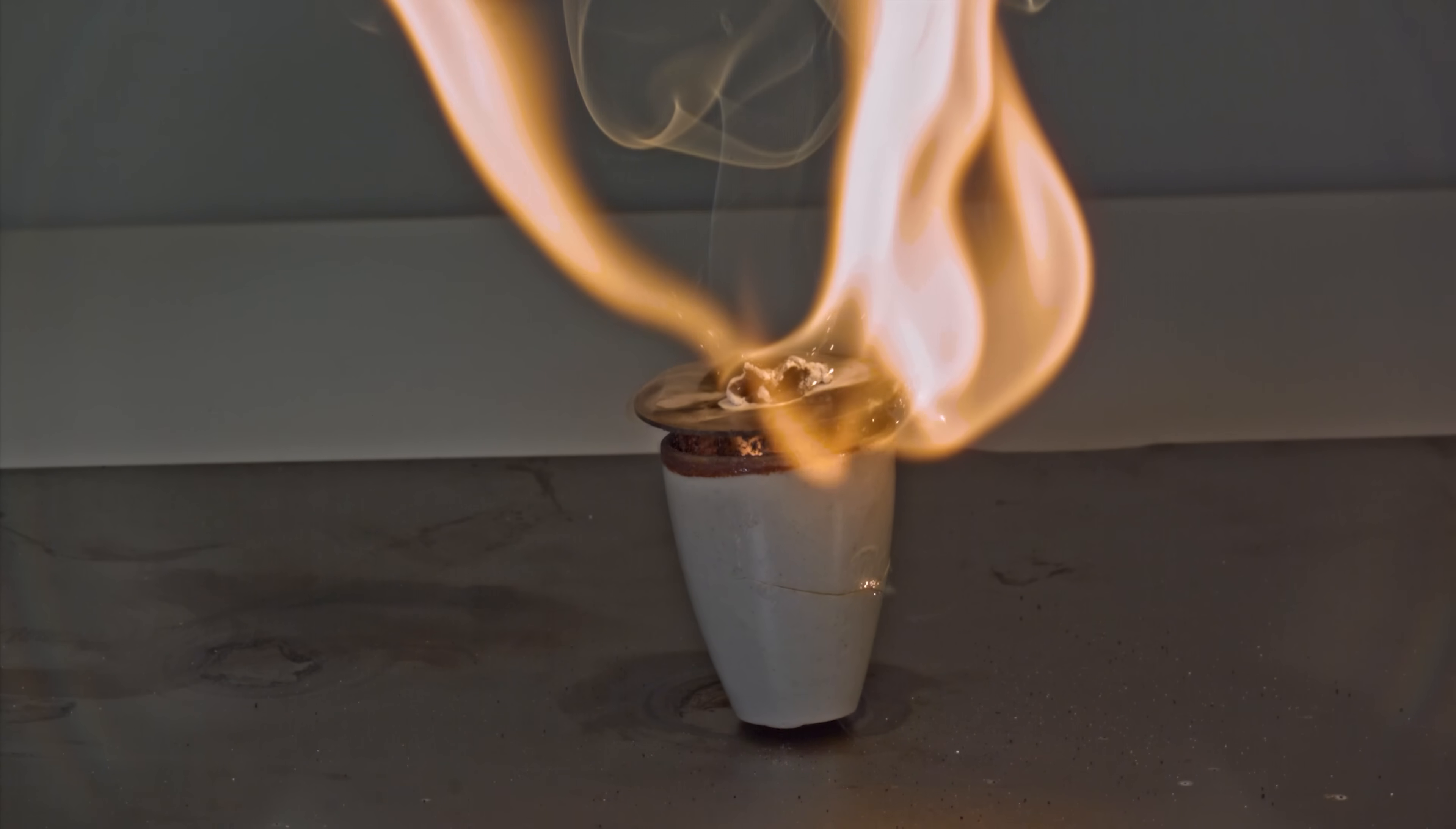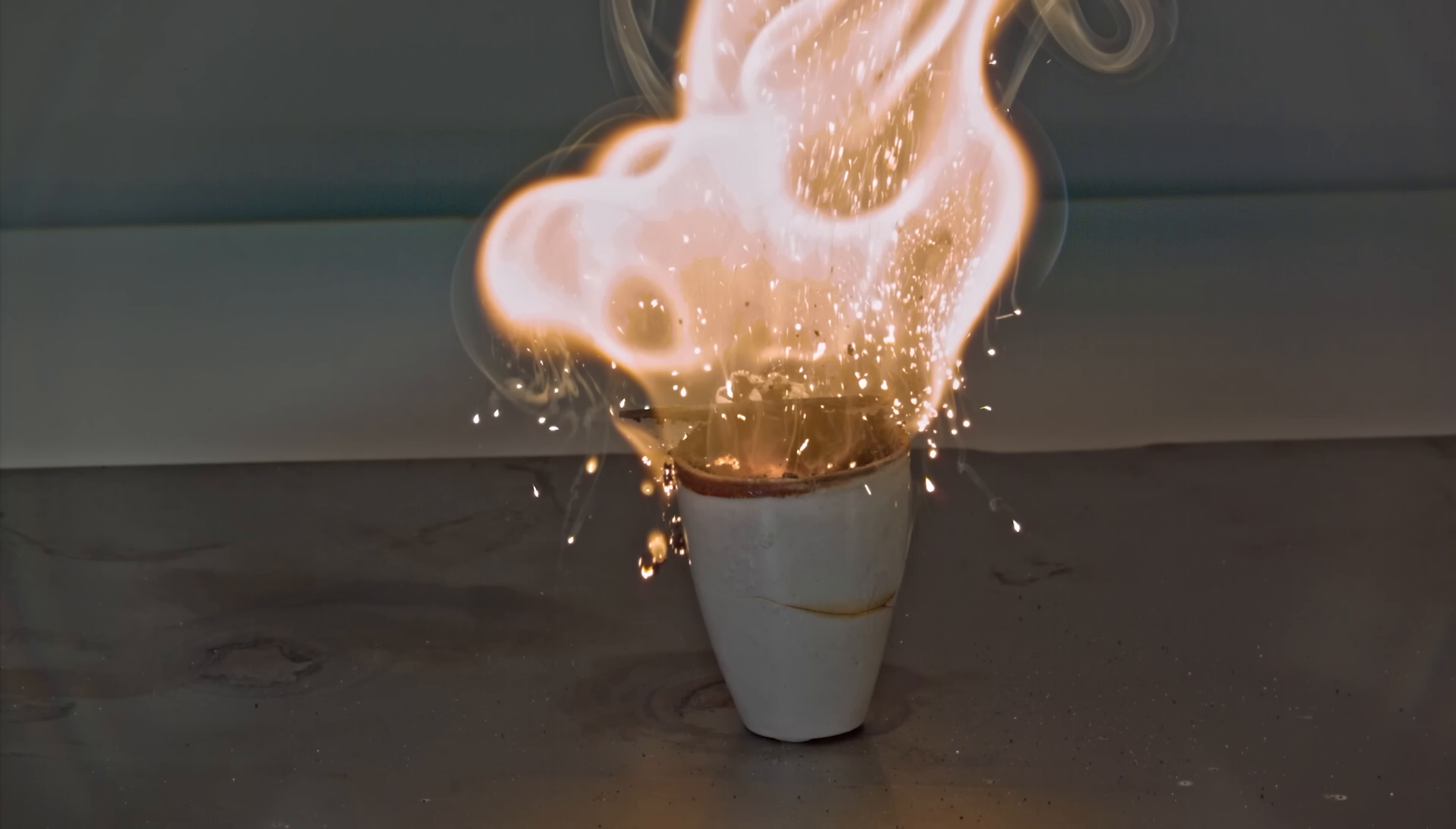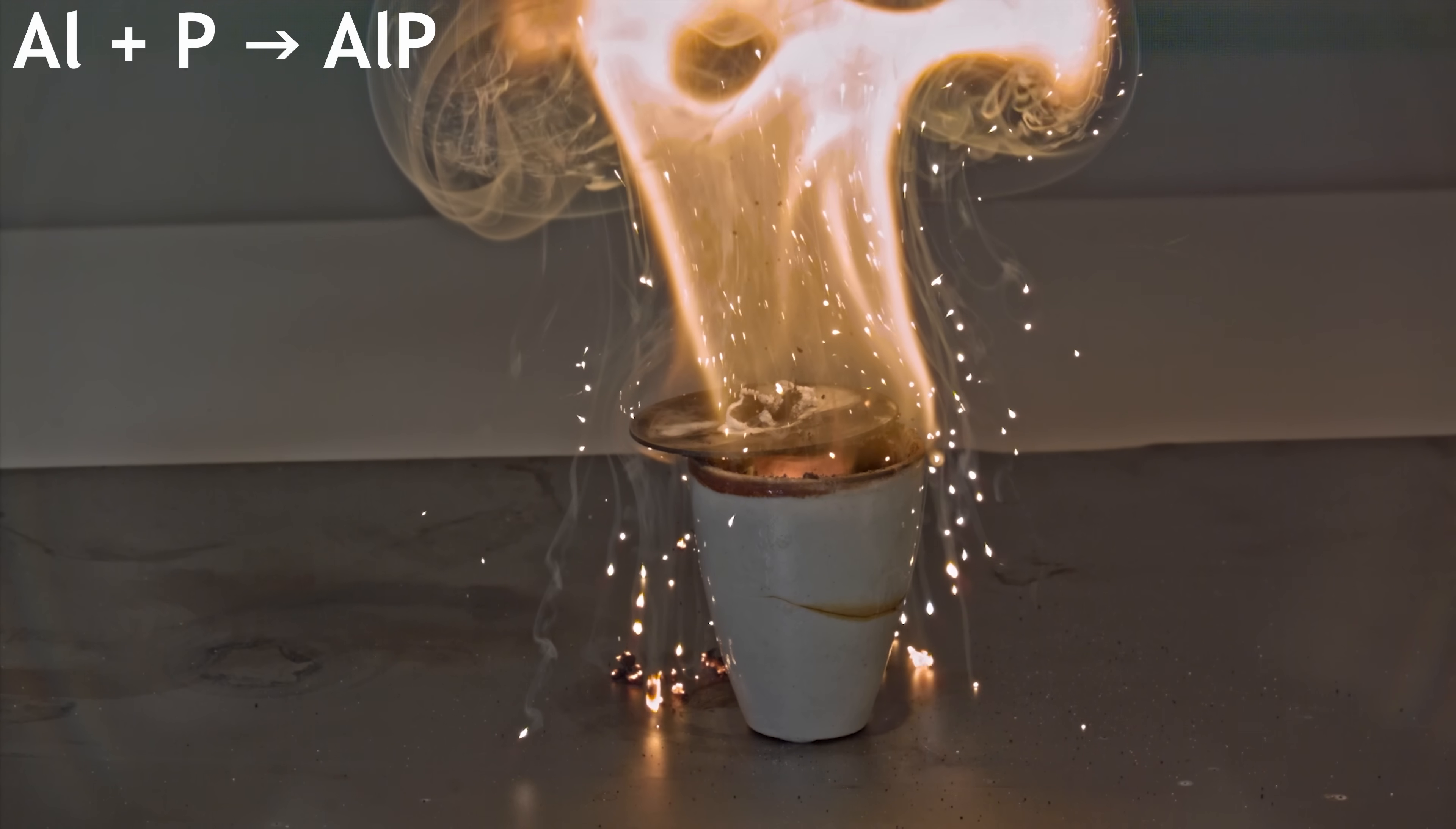Hey guys! In this ceramic crucible, a chemical reaction is happening between aluminum and phosphorus, resulting in the formation of aluminum phosphide.